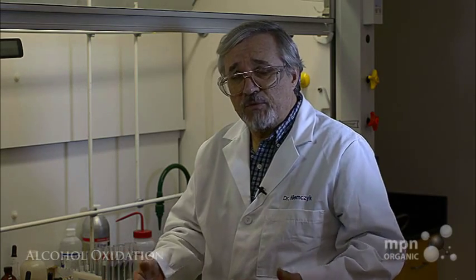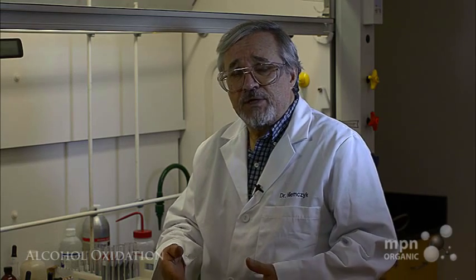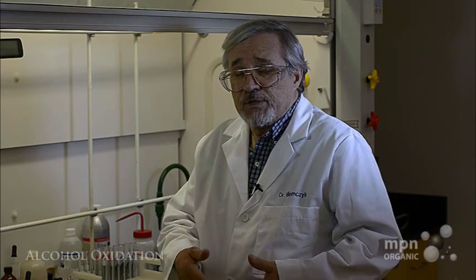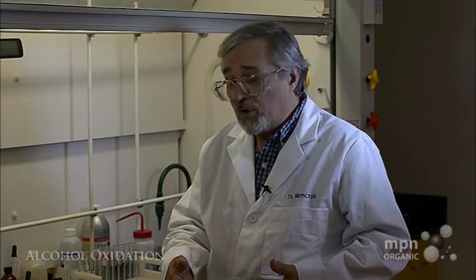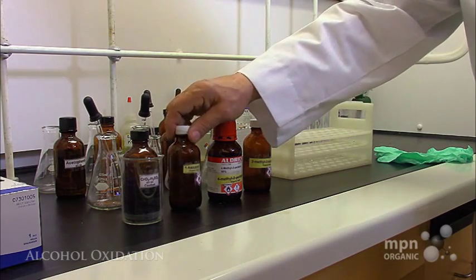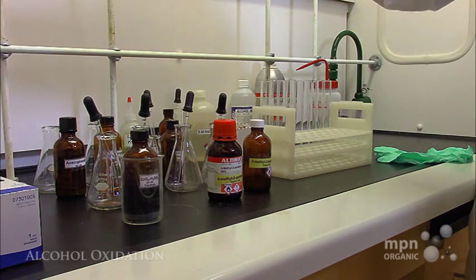We're going to explore a demonstration which organic chemists, especially students in the second semester, will find both useful and will encounter in the laboratory when they do a qualitative analysis experiment with alcohols.